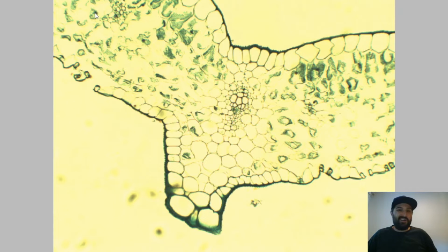The reason I can infer, really, other than looking at the vascular bundle here, that this is the lower epidermis, is that there's actually the stomata. So you can see those things here, with the associated cells. What were those two cells called? Those really highly specialized cells. What were they called in each stomata? There's the stoma, and then controlling the stoma were those two cells. What were those two cells called?